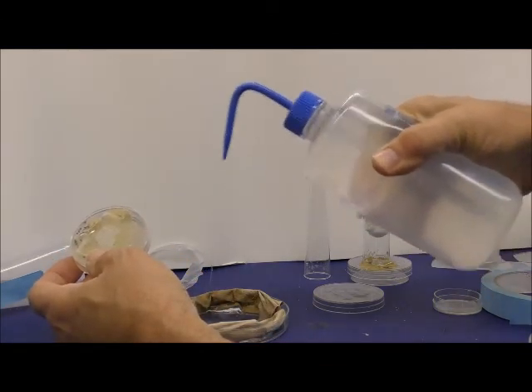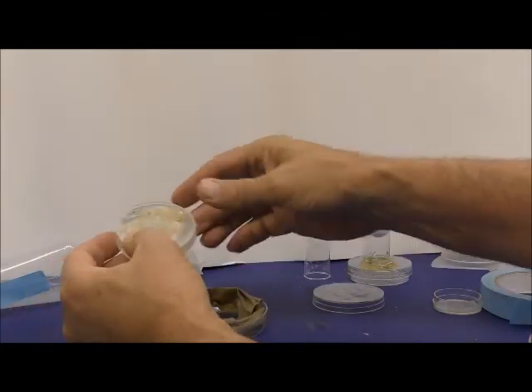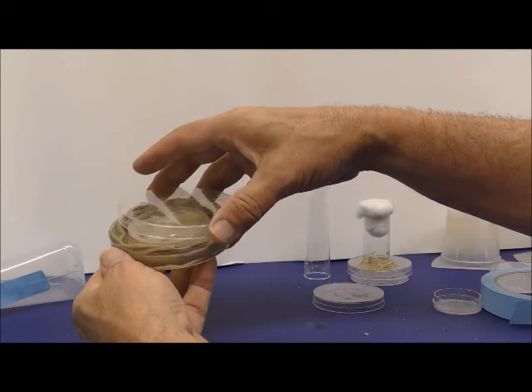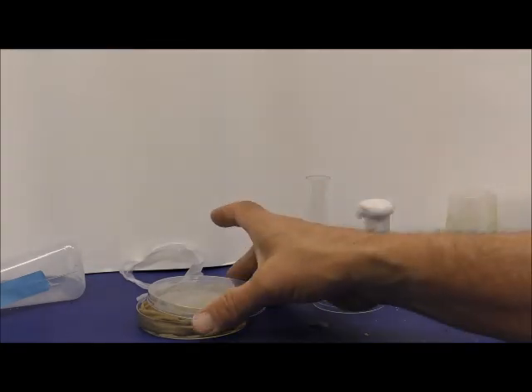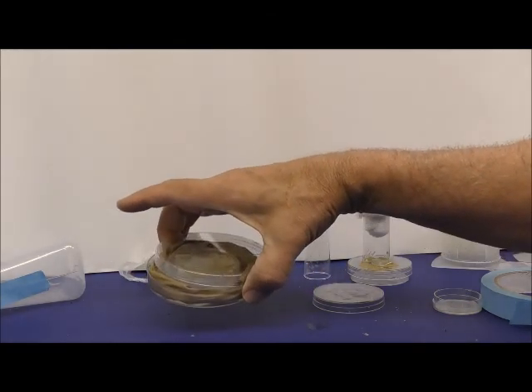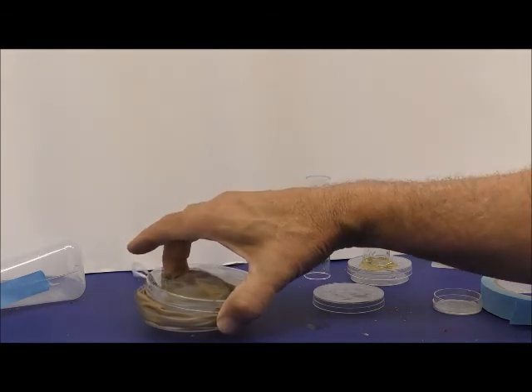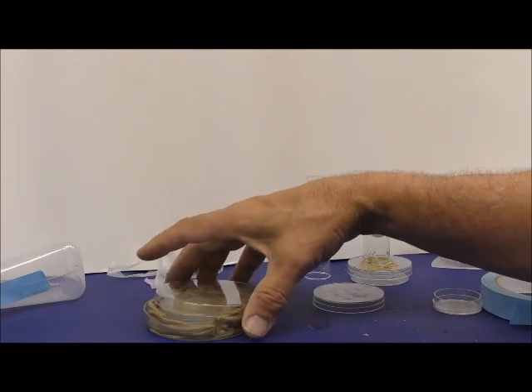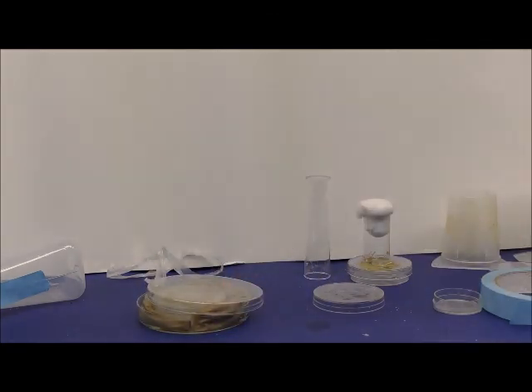And now we have a wet paper towel and moisture. And then if you put this inside of that, and then put the lid not where it's tight, because that'll build up the CO2, but where you have a crack like that, so the CO2 can get out, but then you'll have the larvae and they'll stay moist. It depends on how dry your room is, for example, but we tend to find that this works pretty well to keep the food and the agar from drying out. Just don't close the lid fully, because the CO2 will build up and kill the larvae. Okay, so hopefully that will do the trick.